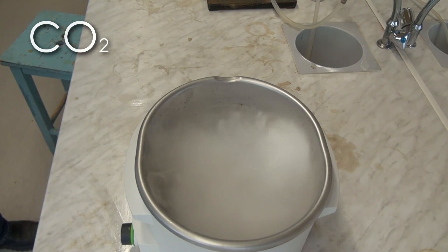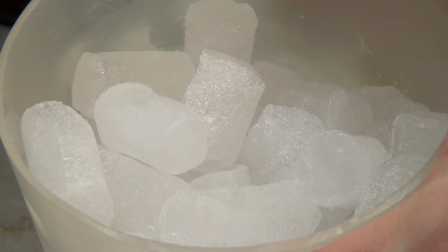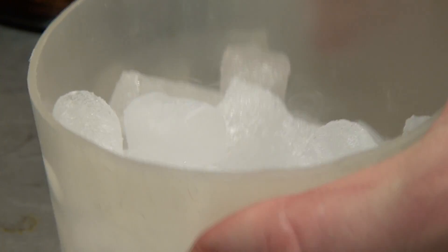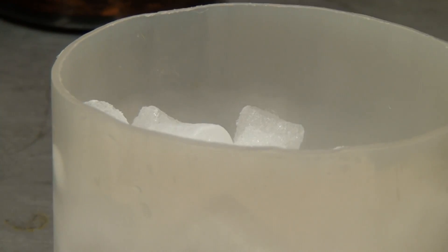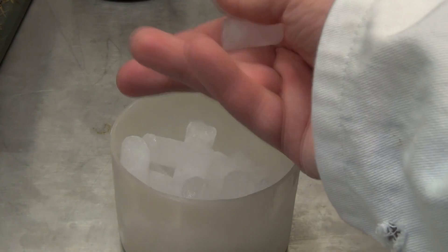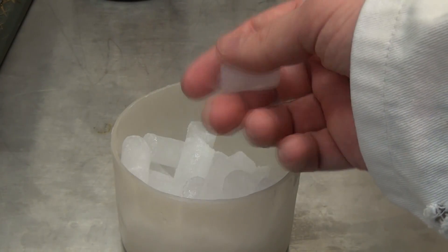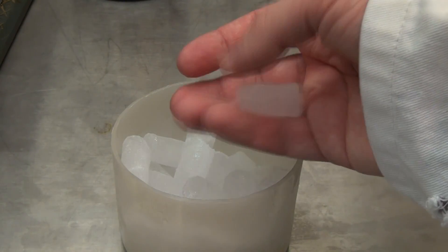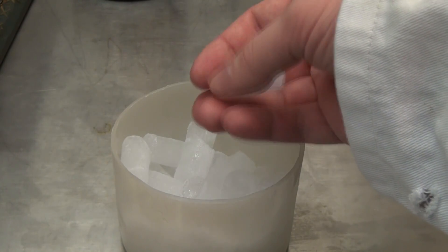At first we can look at how dry ice actually looks like. In our laboratory it's stored in these small cylinders. Dry ice can be taken with bare hands, as long as you don't squeeze it, as you can get frostbite, which isn't good for you.